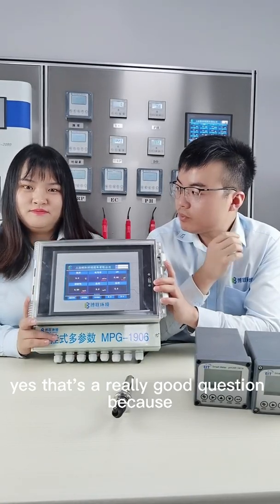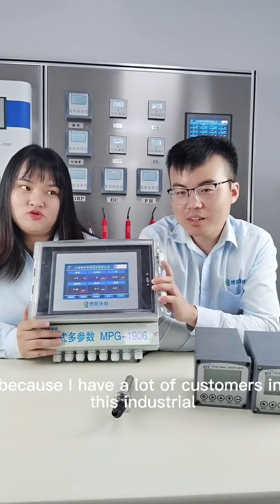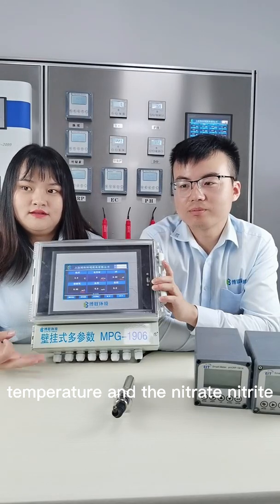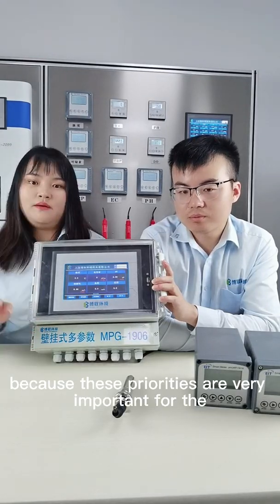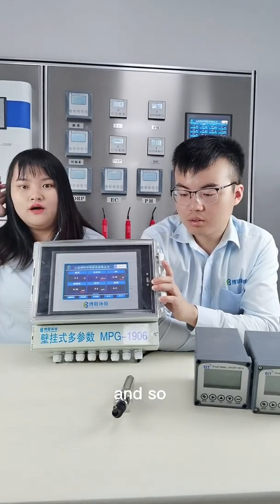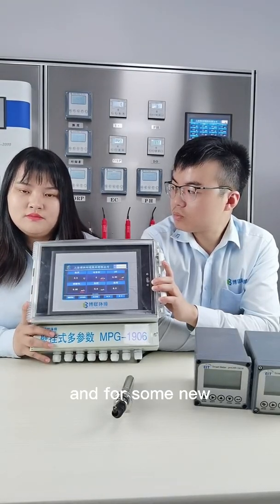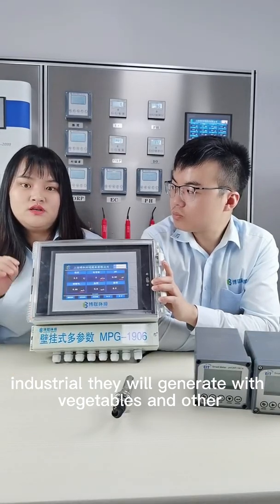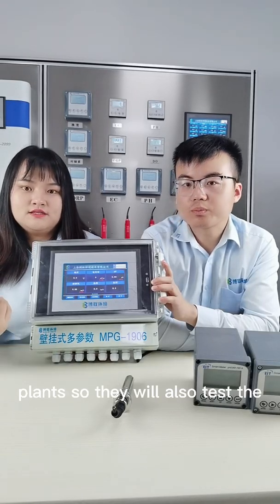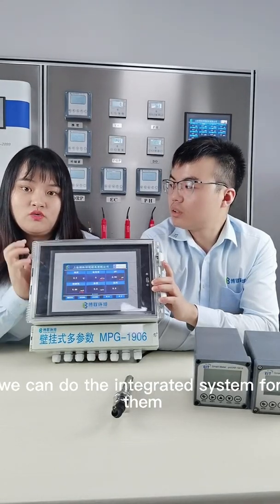Yes, that's a really good question, because I'm very professional in this industry, I have lots of customers in it. Generally, it needs to test pH, dissolved oxygen, temperature, and nitrite, because these parameters are very important for the fish to survive. So I will suggest the customer test these parameters. And for some new industries, they will grow vegetables and other plants, so they will also test the air temperature and air humidity. We can do the integrated system for them.